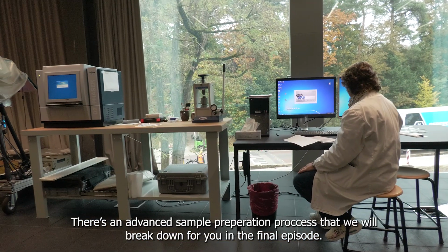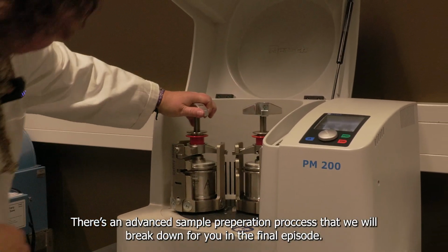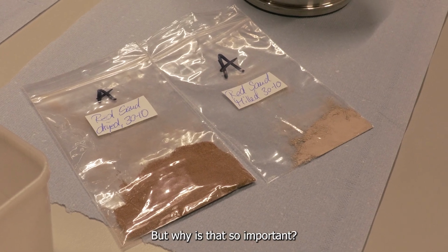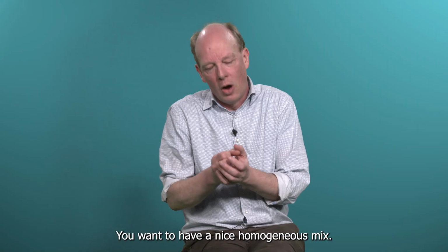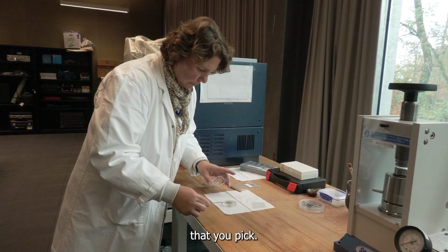But using the XRD machine is not a matter of just putting some grains of sand into the sample holder. There's an advanced sample preparation process that we will break down for you in the final episode, which includes the grinding of the samples. But why is that so important? You want to have a nice homogeneous mixture. You want all the minerals to be present in the little scoop of material that you pick.